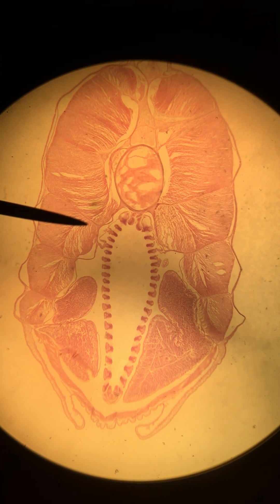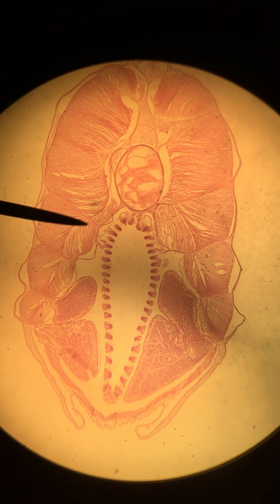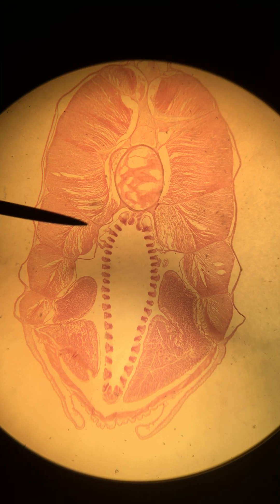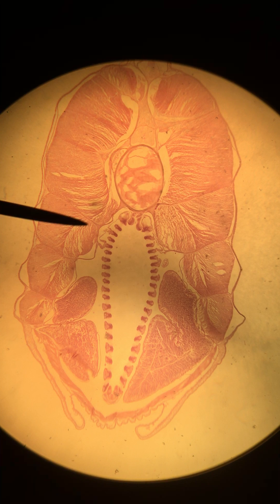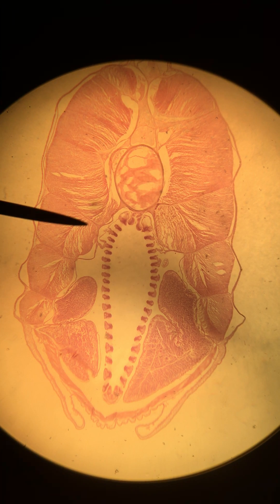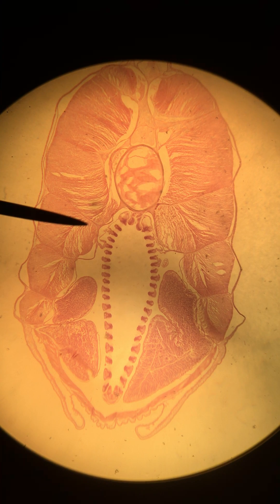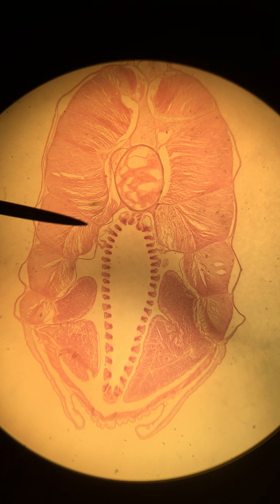Hi Gen Bio, Dr. Fry again. I am now showing you a cross-section through the middle of our Amphioxus or Lancelet, and this one is to compare with the last one because this one is a male whereas the last one was a female.